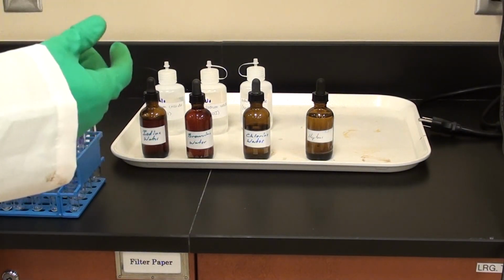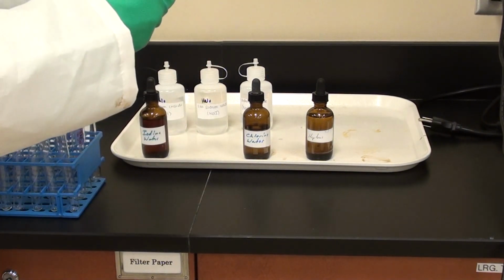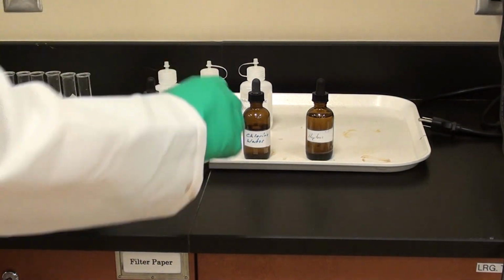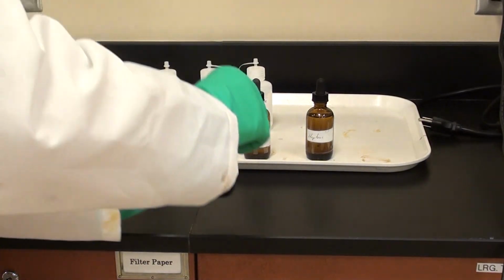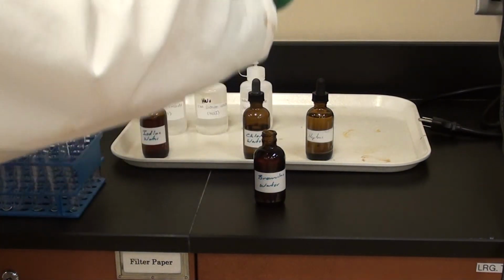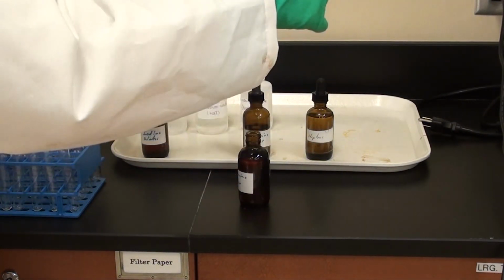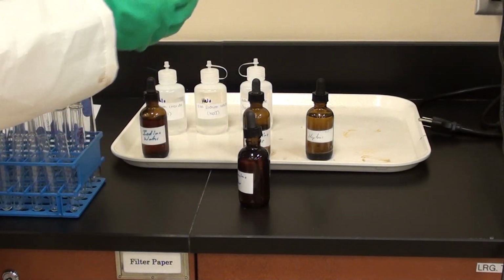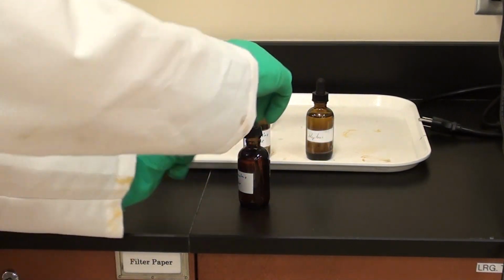Okay, so I'm taking a test tube. And this is my bottle. This is labeled bromine water. Could you just put that down, there we go, that's good. And I'm going to add, now you don't have to be that careful about how much you're adding here. About a couple of fingers worth, maybe 2 squirts of this, give or take. Just enough so you can see what's going on. That's a good amount. I like that.